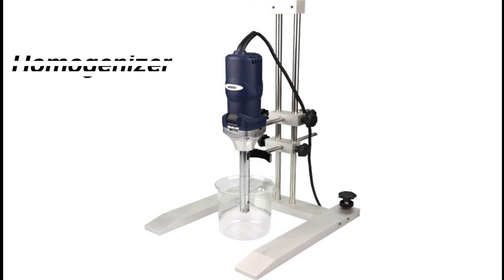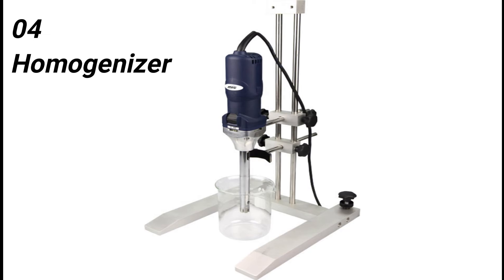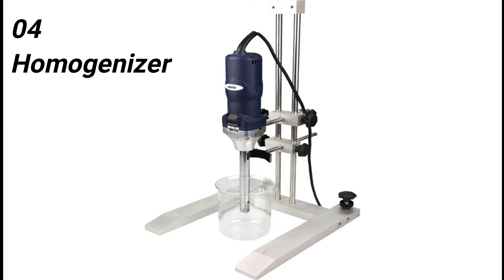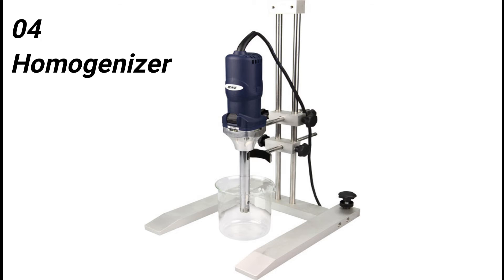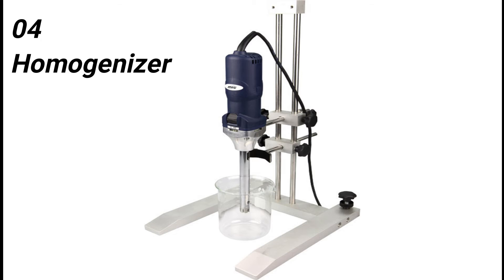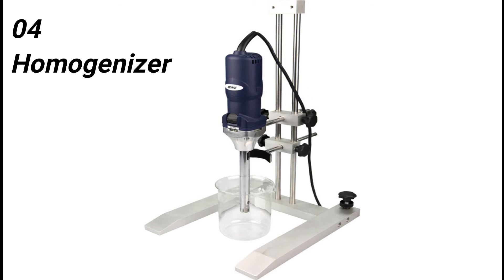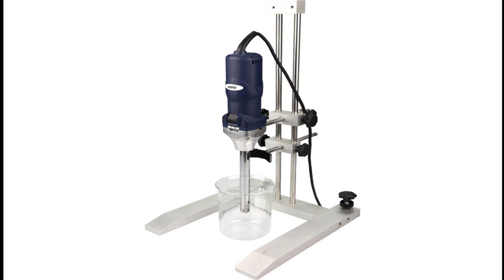On number 4, I would like to tell you about homogenizer. A homogenizer is a device used in laboratories for the mixing of various liquids and materials like tissue, plant, food, soil, and many others. It is primarily used to disrupt cells to acquire cell organelles for different microbiological processes. It is also used in the preparation step before the extraction and purification of different macromolecules like proteins, nucleic acids, and lipids.